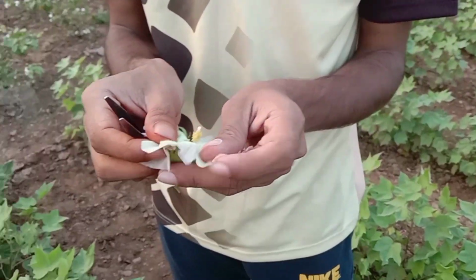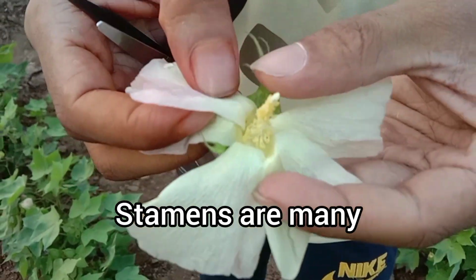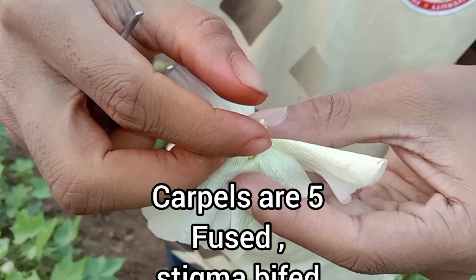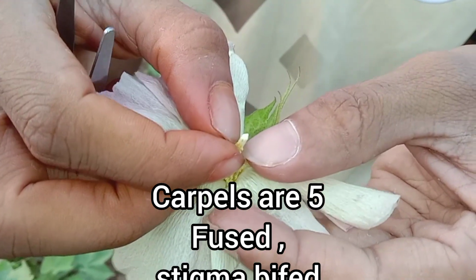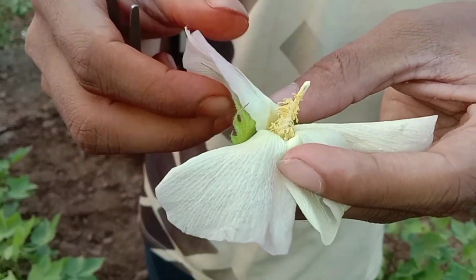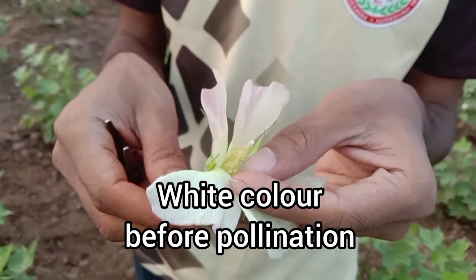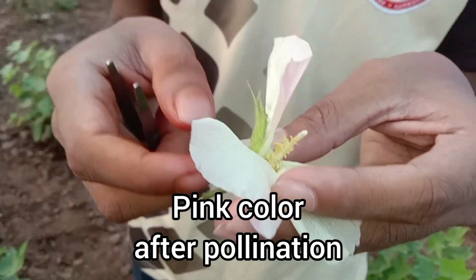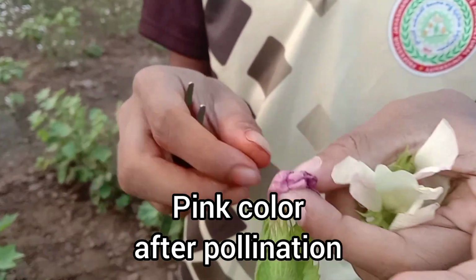And it contains a numerous number of stamens. See, all these are stamens, and the carpels are 5 and they are united together and bifid in condition. See, this is the stigma, the carpel which is fused together. They are 5 in number. One of the important characters is that before pollination the flower color is white, and after the pollination the flower color changes into pink.